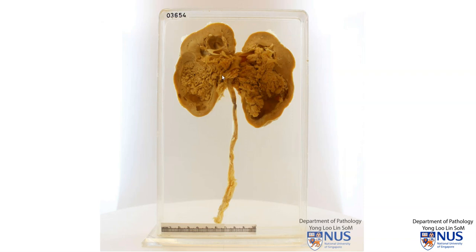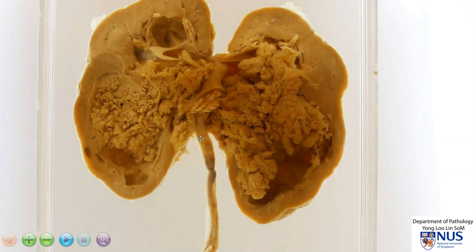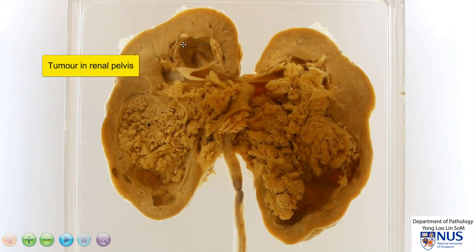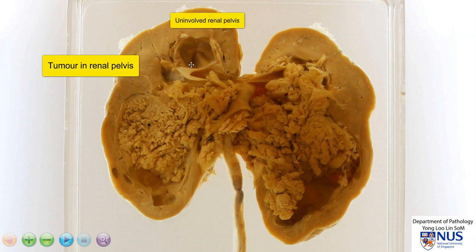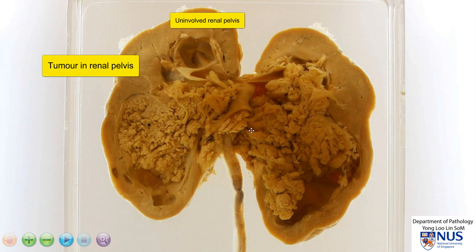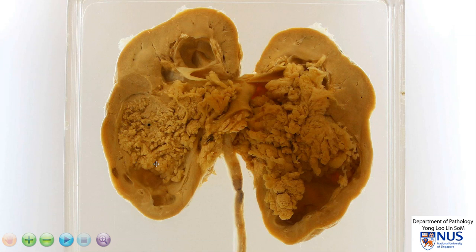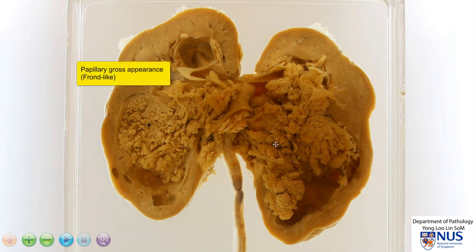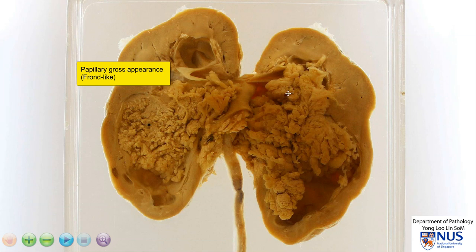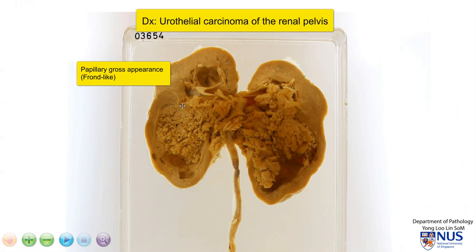The obvious abnormality here is the presence of a tumour involving most of the renal pelvis. We can see a little bit of residual uninvolved renal pelvis here. It does appear to be somewhat dilated, possibly due to obstruction by the tumour. The tumour appears to be very papillary or frond-like grossly, with fronds protruding into the renal pelvis. This is an example of urothelial carcinoma involving the renal pelvis.